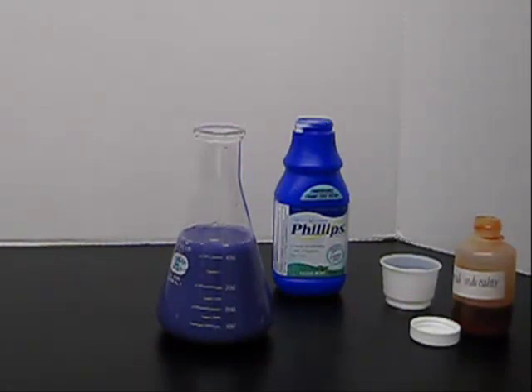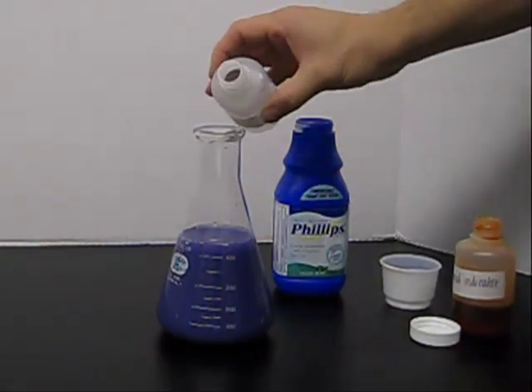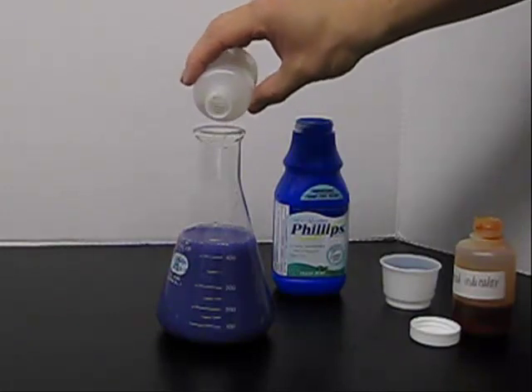Now finally we are simply going to add HCl to this solution. And we are using 3 molar HCl. It really does not matter. Just add a little bit.